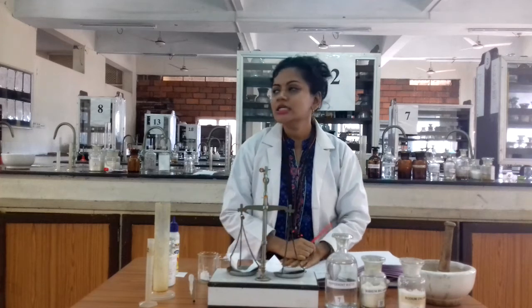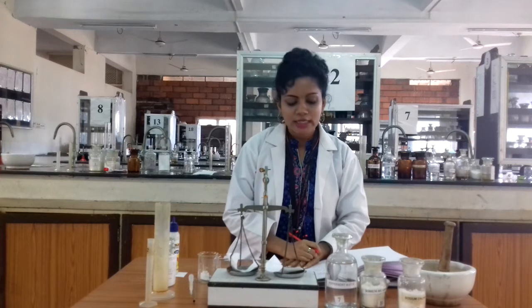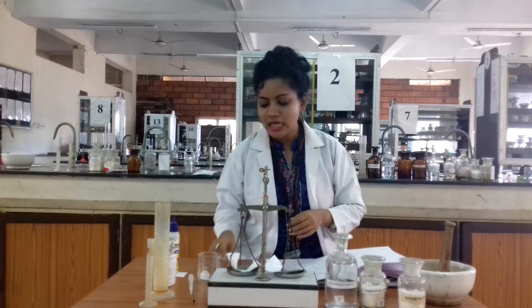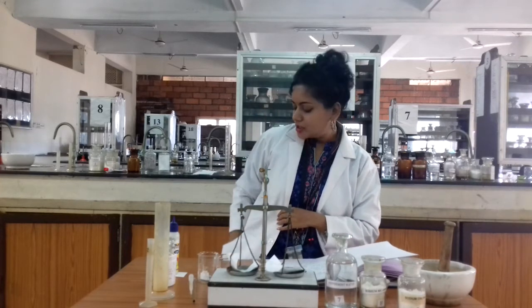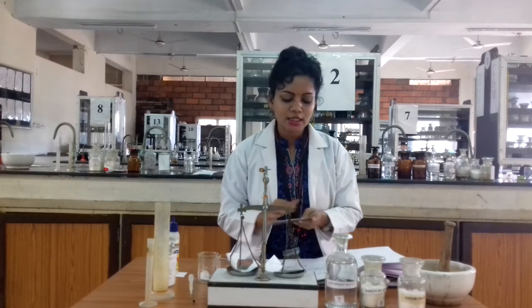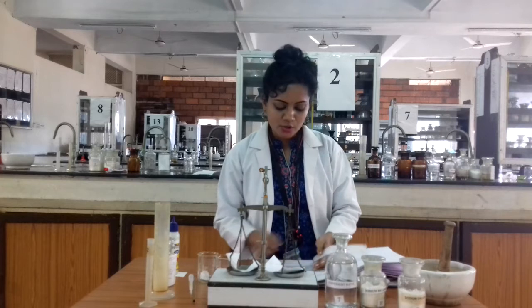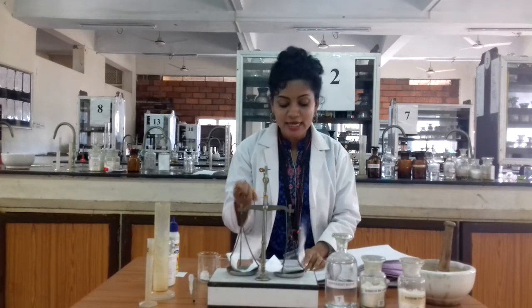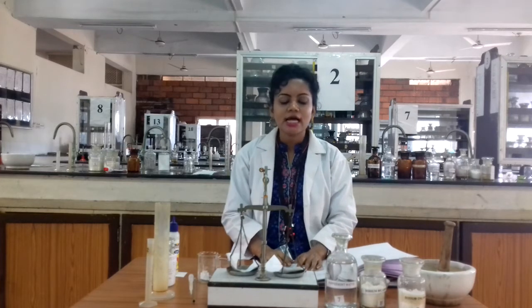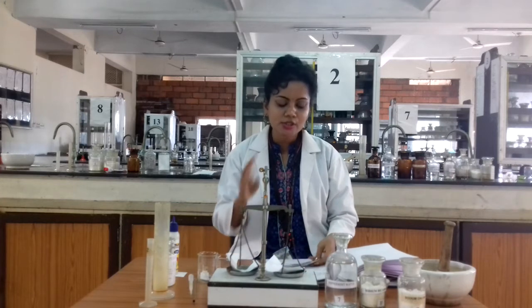This practical section is mainly based on mouthwash preparation. Today I am going to make the sodium chloride mouthwash. It is an alkaline mouthwash category. In your exam, two questions are given for your practical section. The first question mostly asks to dispense 50 mL of alkaline mouthwash, and if alkaline mouthwash is specified, it is called the sodium chloride mouthwash.